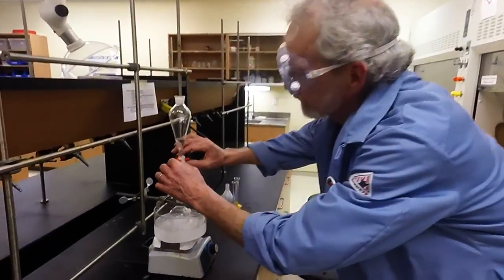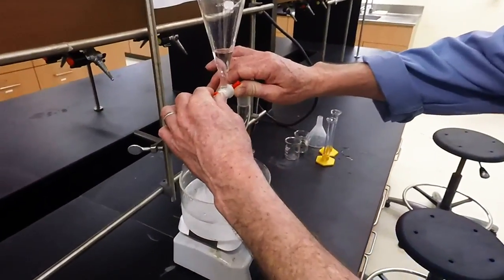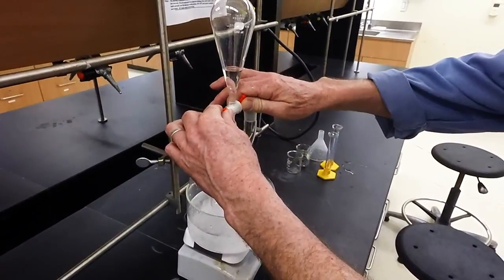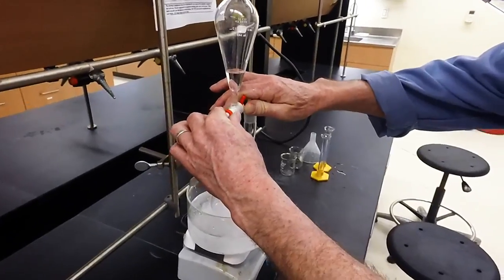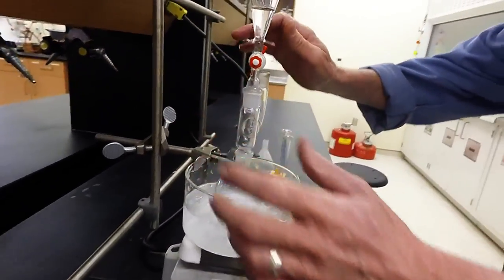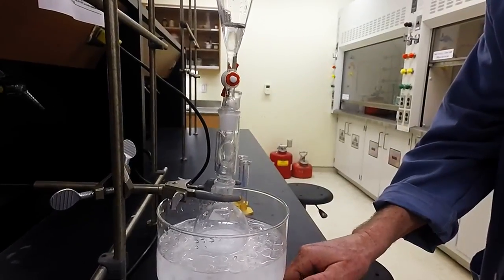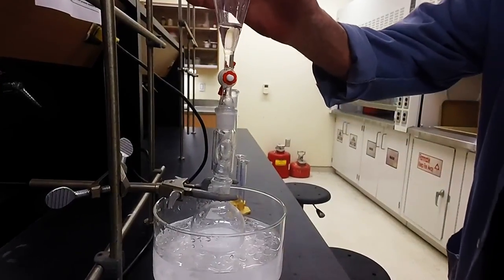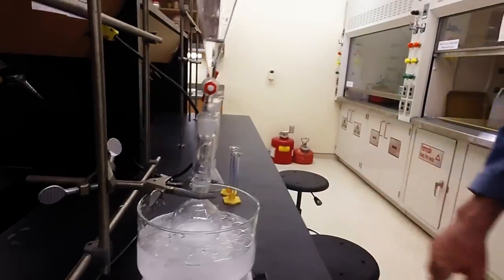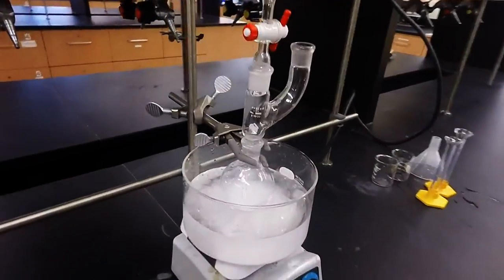So, this time we're going to be adding our sulfuric acid slowly. Remember, there's going to be a lot of heat generated here. We're looking for two or three drops a second. Get that going. Keep the stirring. There. Now we wait.